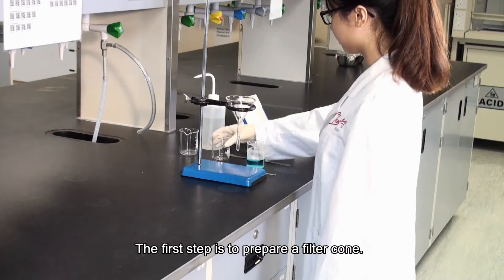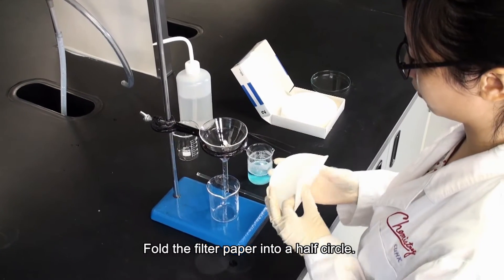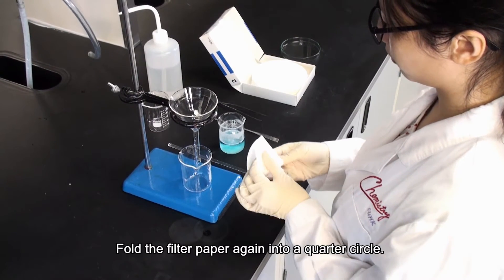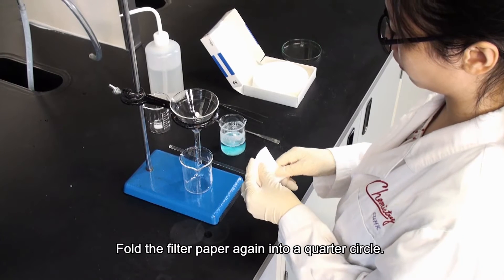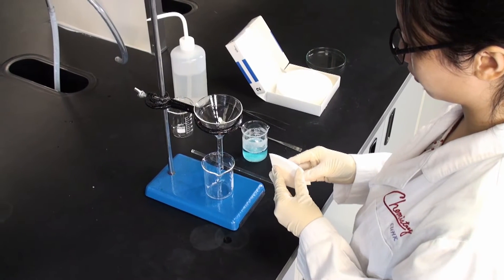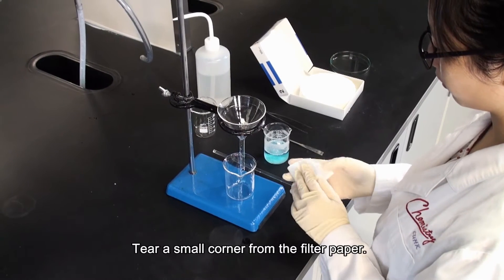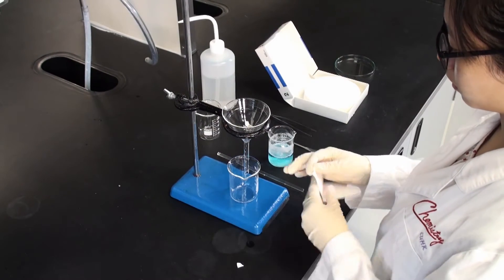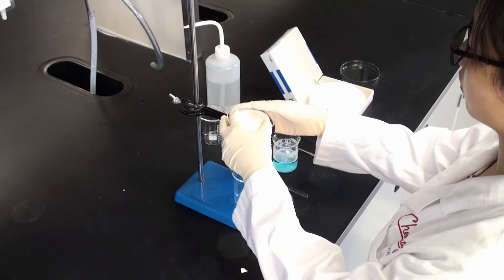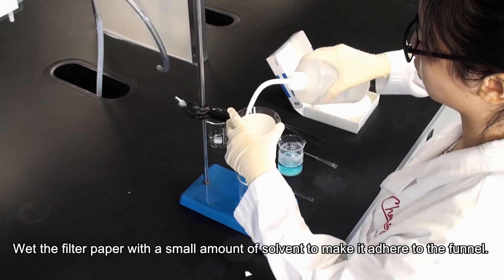The first step is to prepare a filter cone. Fold the filter paper into a half circle, then fold it again into a quarter circle. Tear a small corner from the filter paper. Open the filter paper and place it into the filter funnel. Wet the filter paper with a small amount of solvent to make it adhere to the funnel.